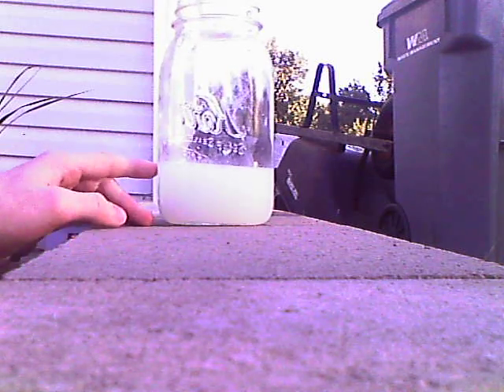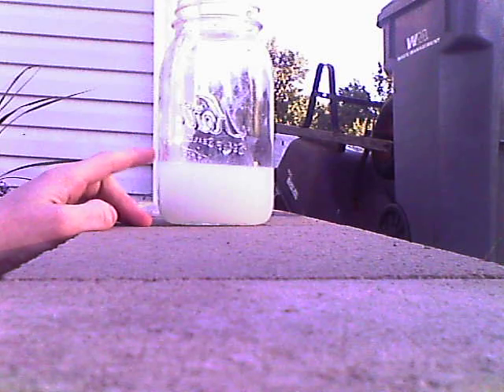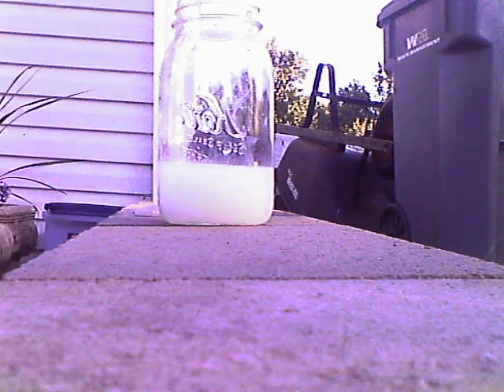What this is doing is producing sodium citrate and hypochlorous acid. You can replace the citric acid with acetic acid or another organic acid. Acetic acid also comes in 5% in the form of distilled vinegar.